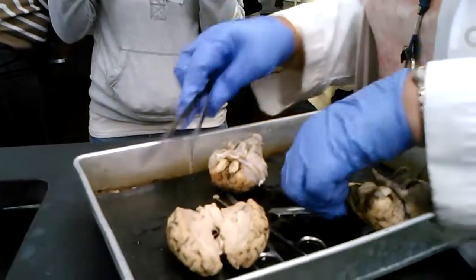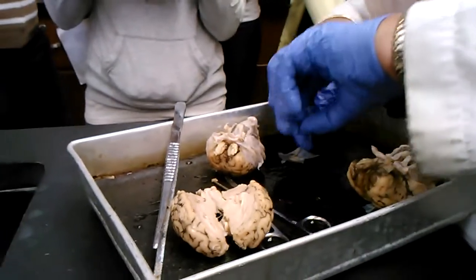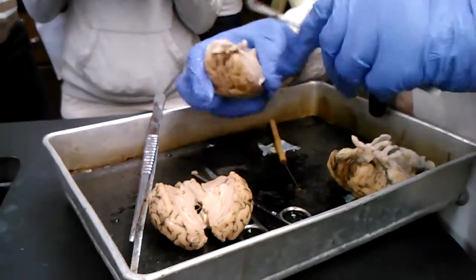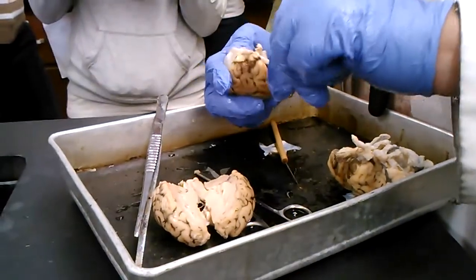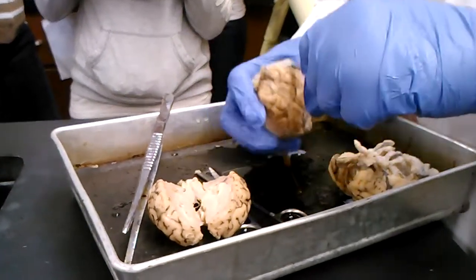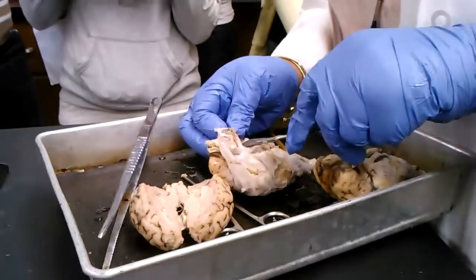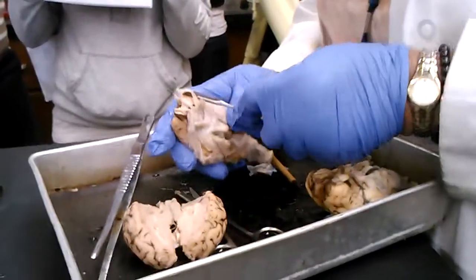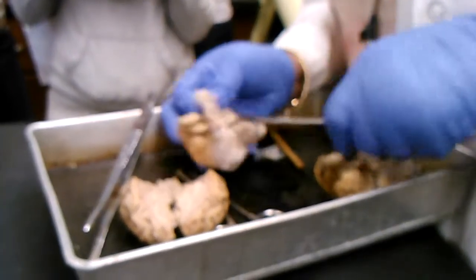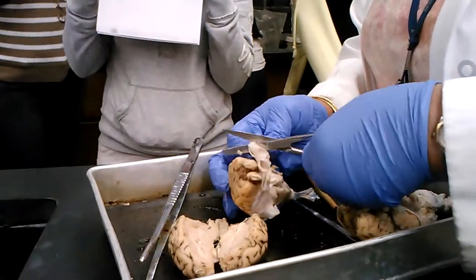Is anyone game enough to do a dissection? You can take a tray and open. Meanwhile, I'll be working on the cow's eye. So here's a nice one that we can work with. We don't want to cut the... I showed you the things that are testable on the sheep brain itself, so expect to see them.